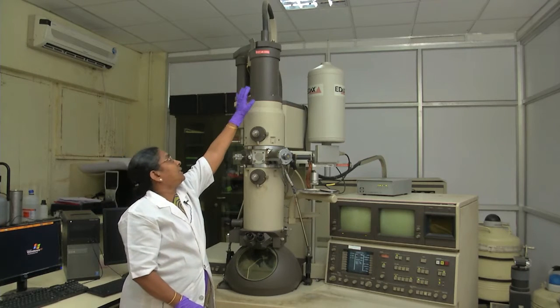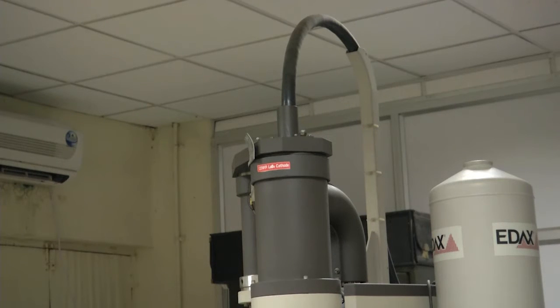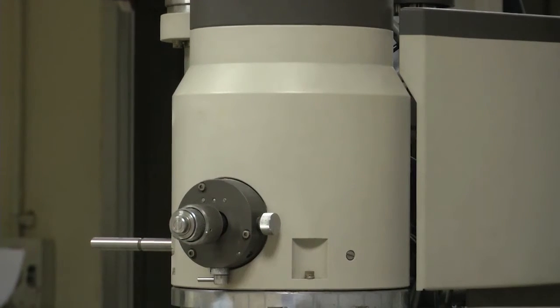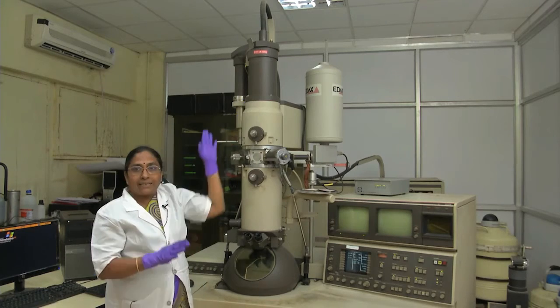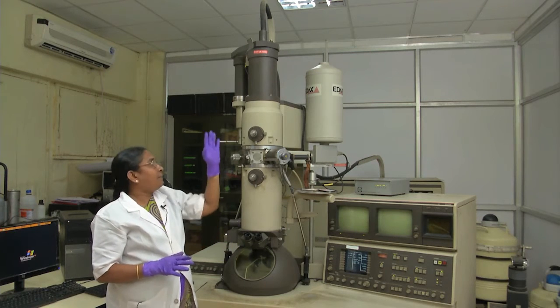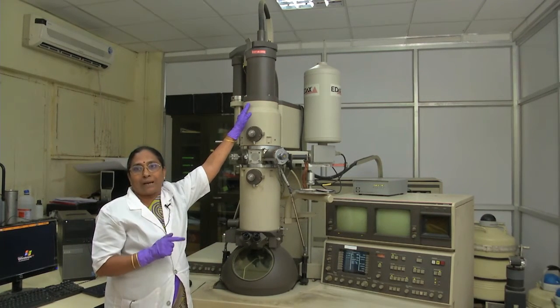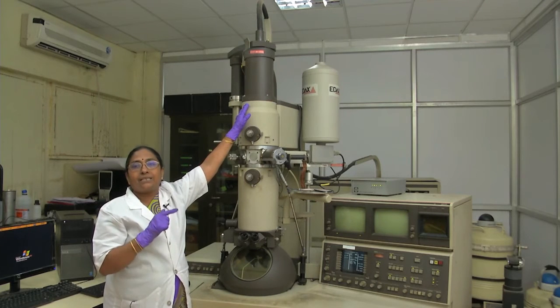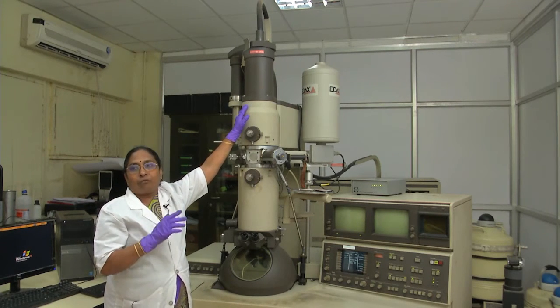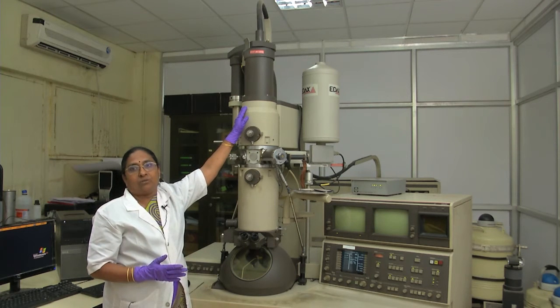At the top is the cathode assembly and the bottom is the anode. From the gun to the specimen area, there are lenses — these are electromagnetic lenses. By applying a current you can change the strength of the electromagnetic field. By changing the strength of the electromagnetic lenses you can form and magnify the image.